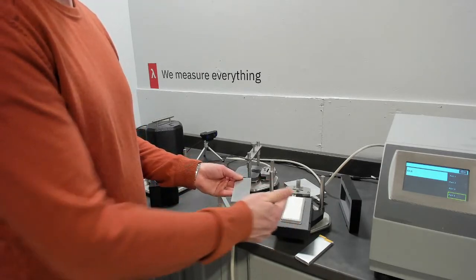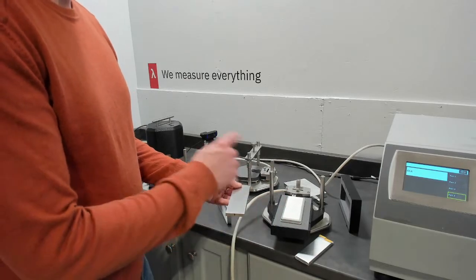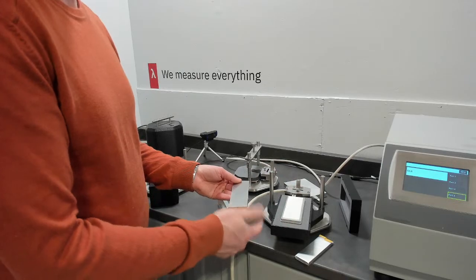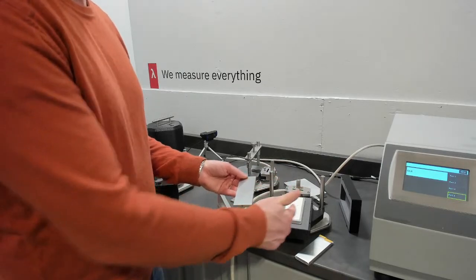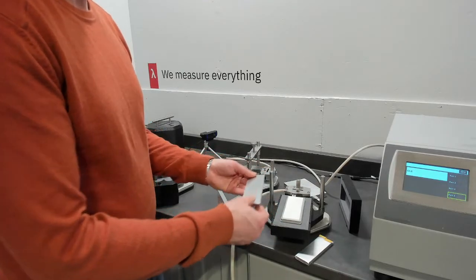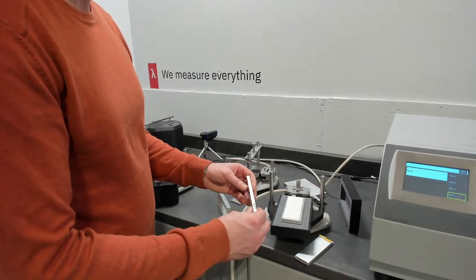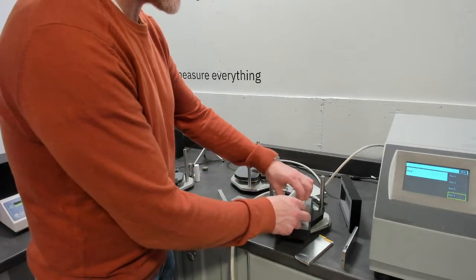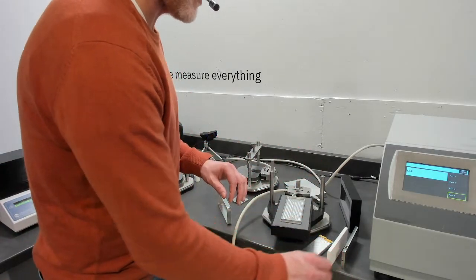If you have these very different conductivities, when you go to measure your anisotropy, it does give you confidence that you're able to measure specific heat on such different materials, and the average of something that is layers of such materials. Of course, the layers inside of a pouch battery could be very different types of metal than 304. But these references are quite good for training and verifying operation.